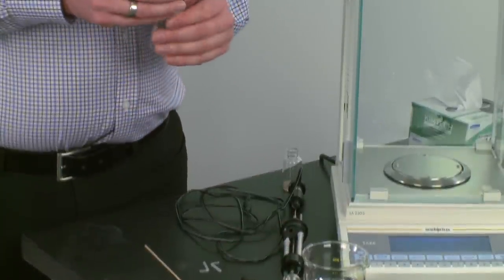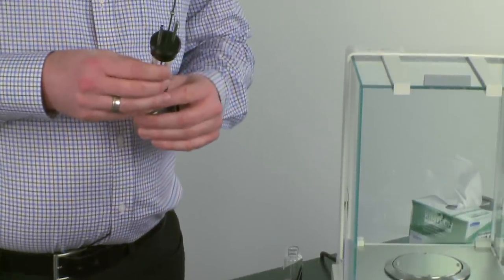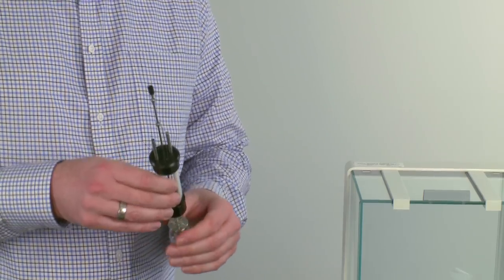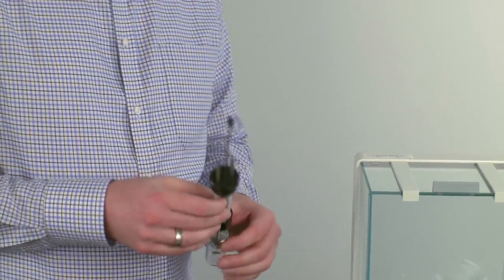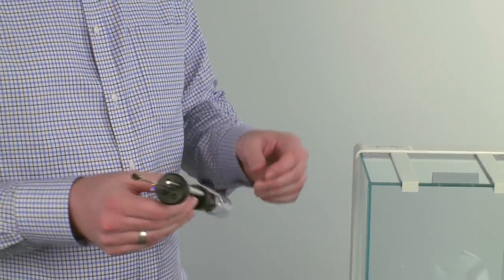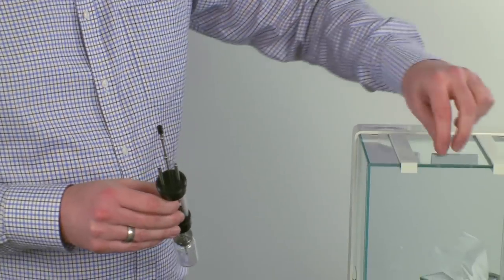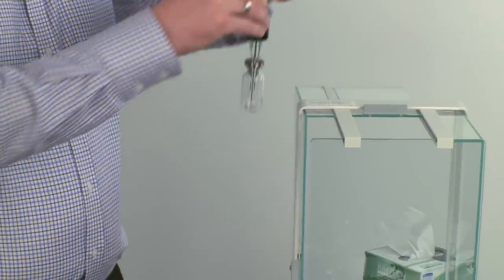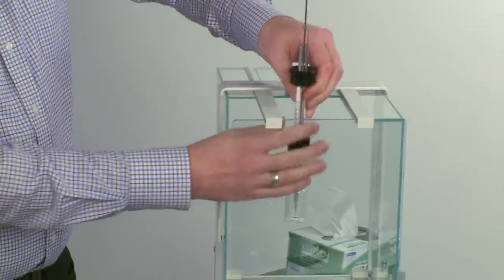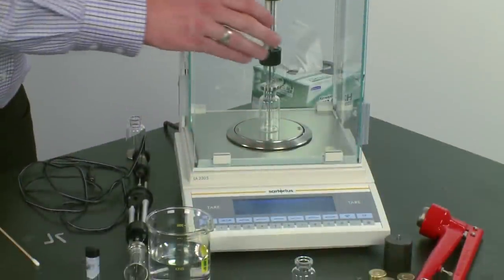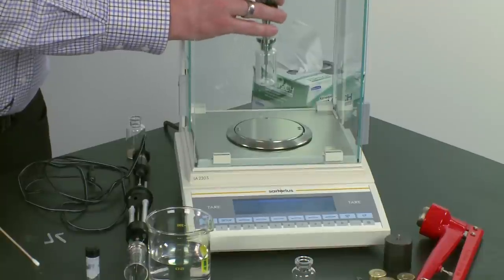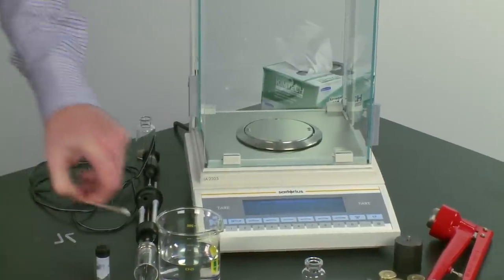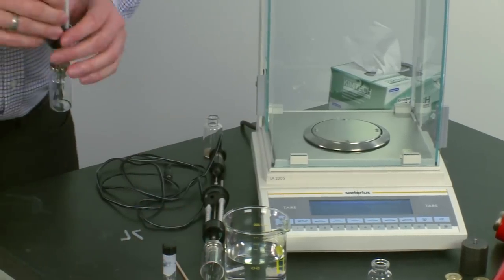Now we'll load the syringe by mass according to the water-cement ratio you're testing. We start by weighing the empty AdMix ampoule with the mounted syringe on a balance, so we can later weigh the ampoule again with the filled syringe.